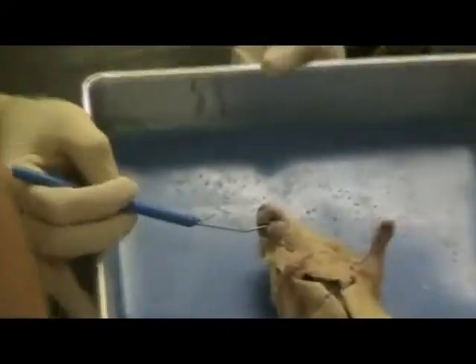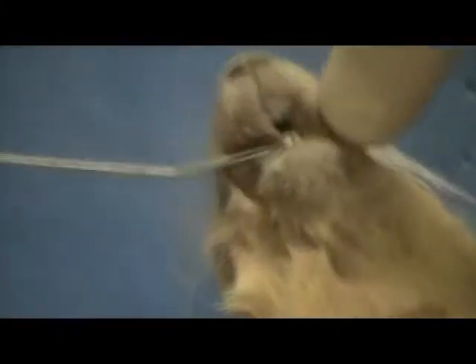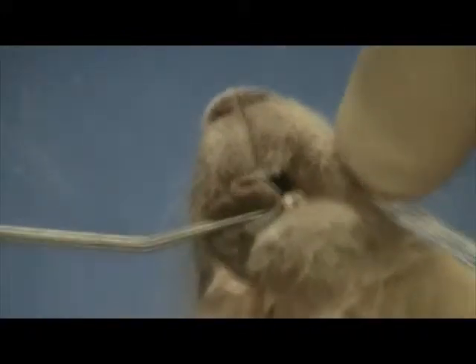There's a second feature I want to talk to you about. You probably think these are teeth. You're right, they are, but the correct term for them is incisors. These large teeth are used for tearing and shearing of the food they eat.